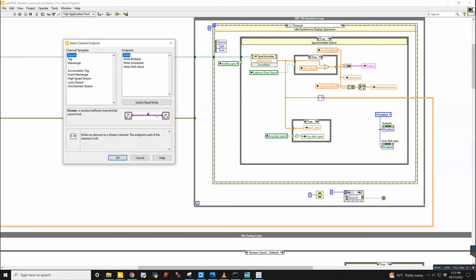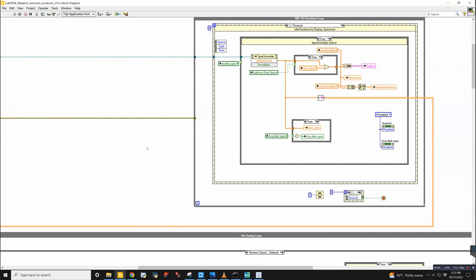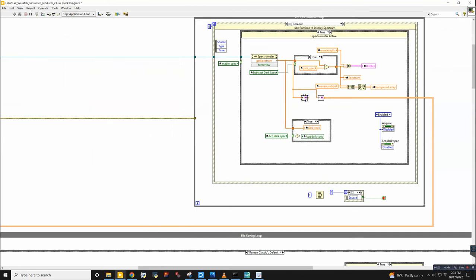What this basically creates is a queue. So you'll see you have a bunch of data streaming into here from one while loop, and then it will go in that order to the second while loop. So it's a first in, first out style of passing data. If you click OK, it takes a second, and then there it is. And then you can wire this directly into another loop like this.